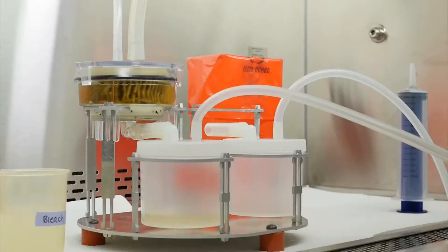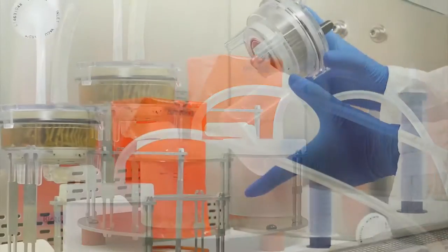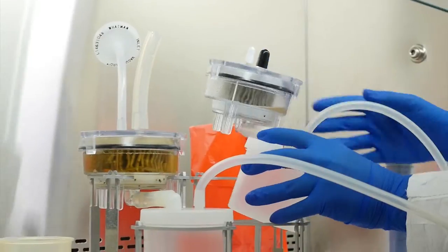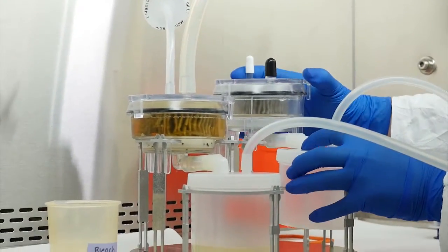An elution device is used to hold the filter and sample collection cup and to connect the bilge pump. The elution device stand can hold up to two filters at a single time.